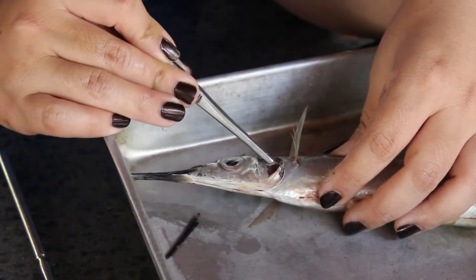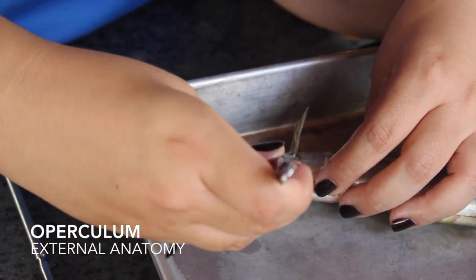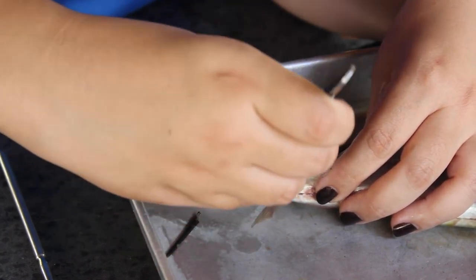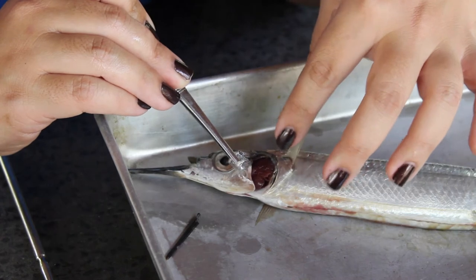This is the operculum, also known as the gill cover. It hides the gills. And if you open it up, you can see the red feather-like gills. That is for filtering out the oxygen from the water.